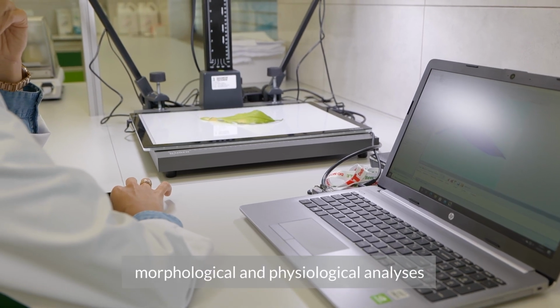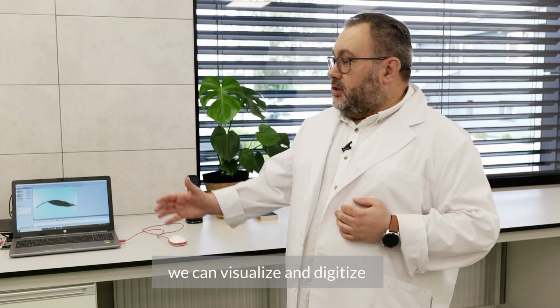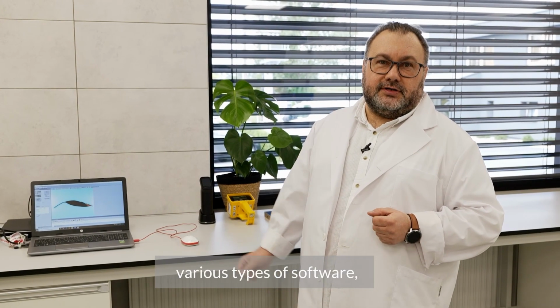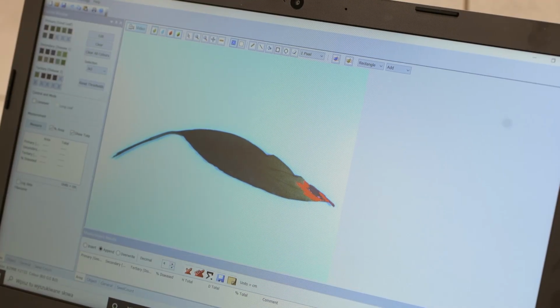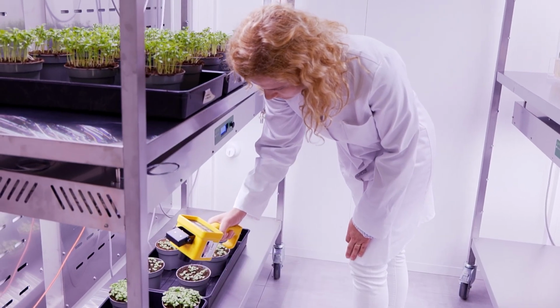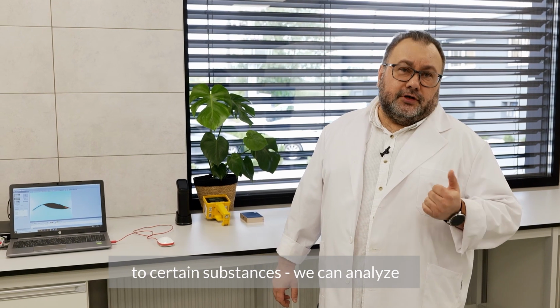Let's start with survival, morphological and physiological analysis of research carried out on plants. Thanks to the state-of-the-art equipment, we can visualize and digitalize the morphological image of plants. This morphological image can then be analyzed by means of various types of software, in order to determine the severity of chlorosis or necrosis that appears on plants. We are able to study various aspects related to plant yield and efficiency, based on the chlorophyll content. As a result, we know how the plants behave in appropriate tested conditions or after exposure to certain substances. We can analyze all of this.